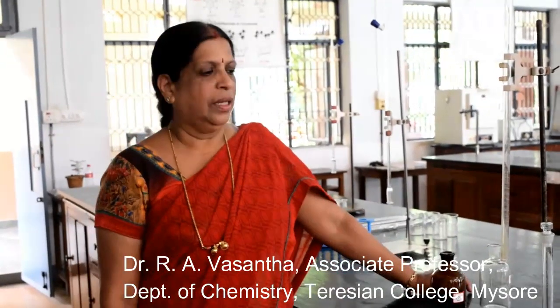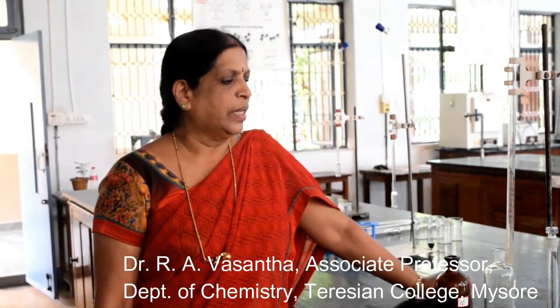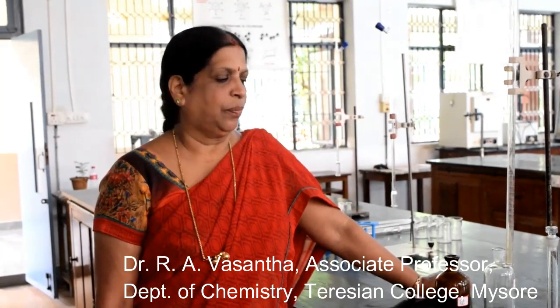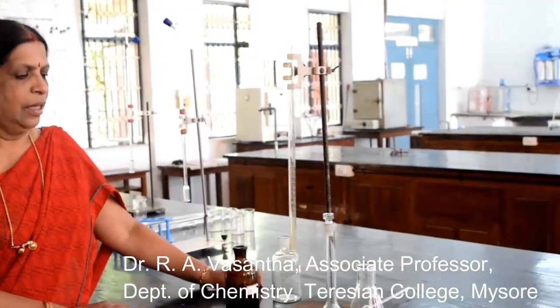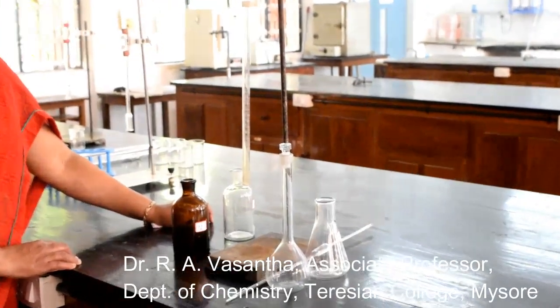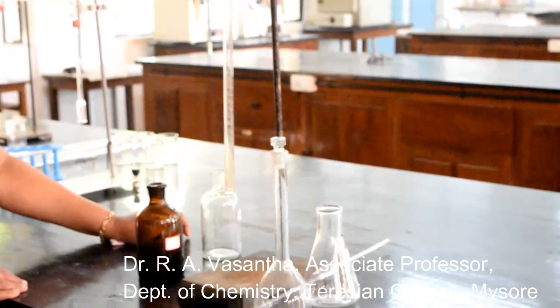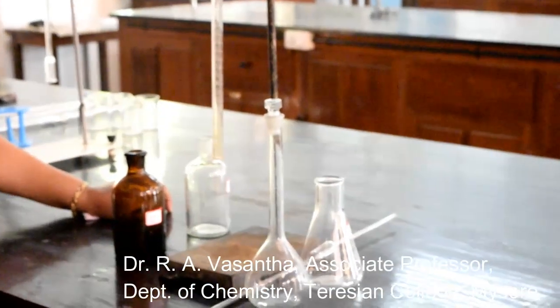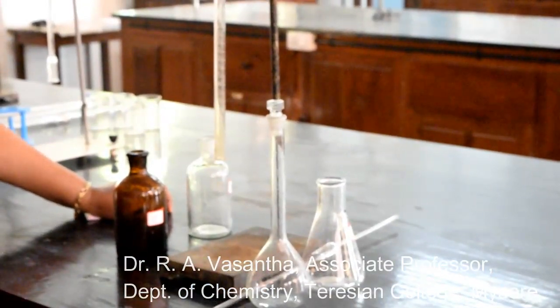Practical 8 comprises volumetric estimations. Two experiments will be set up for Practical 8. One is estimation of carboxylic acid, another is estimation of amino acid. 50% of the students will get carboxylic acid and 50% of the students will get amino acid for the examination.